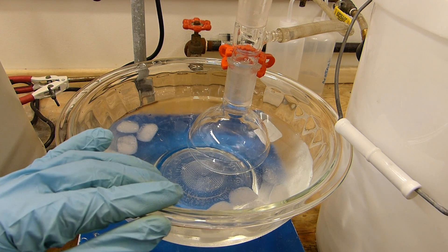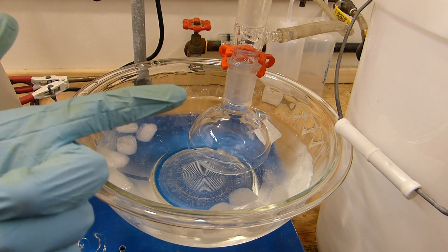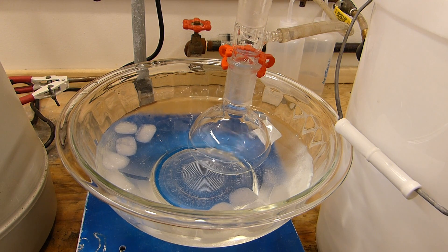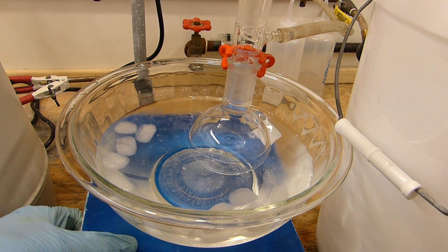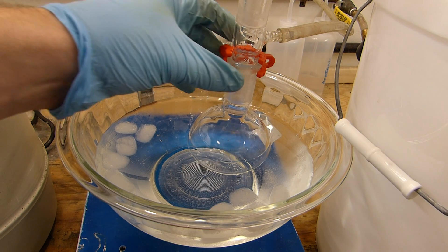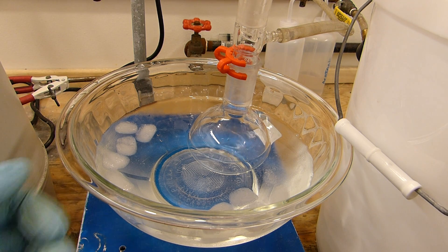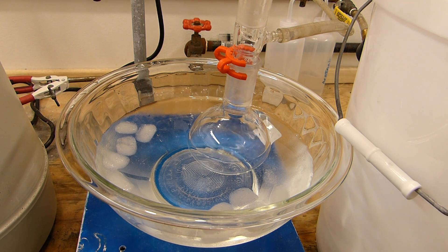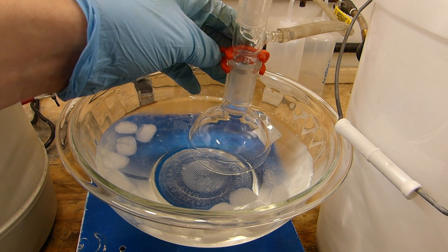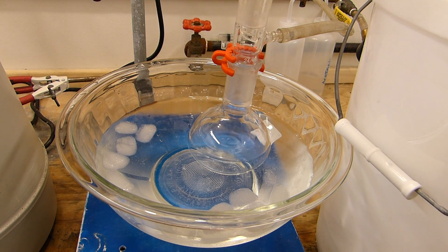Heptane in the ether isn't going to affect it much — it won't affect organic extraction or a Grignard reaction. It's pretty much inert and acts very much like diethyl ether, minus slight solubility in water. For extraction from starting fluid, this quick-and-dirty procedure is just fine. If you're doing something requiring higher purity ether — like HPLC — you'd want to buy it. But for about $11–12 per liter off the shelf, this is extremely cheap.